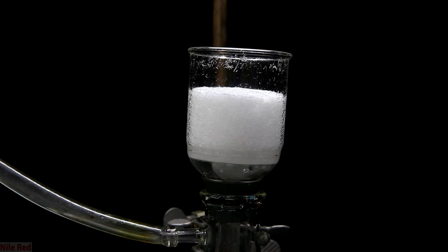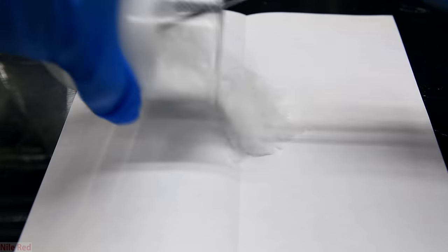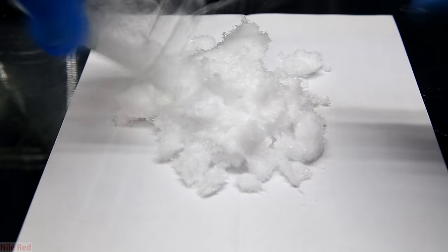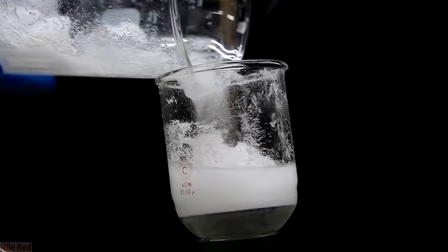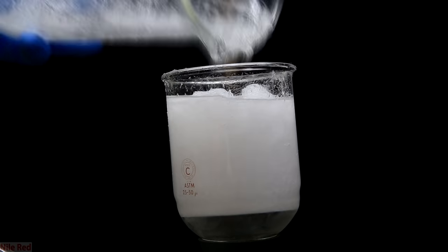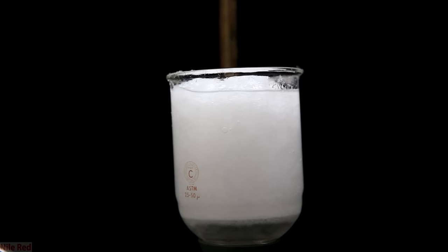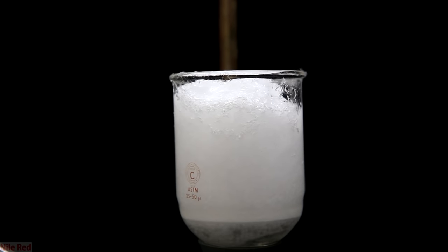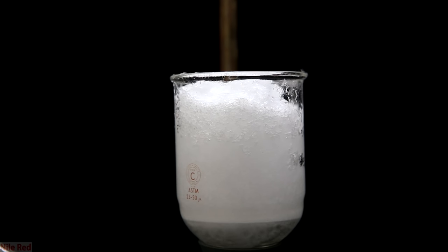By keeping the vacuum on for a few minutes, we can actually get the crystals pretty dry. Once the crystals were relatively dry, I transfer them to a white piece of paper. I then continue with the filtration process by filtering out the second half of the crystals. I followed the exact same procedure as before. I put it in the filter, removed the recrystallization solvent, and then I washed the crystals twice.